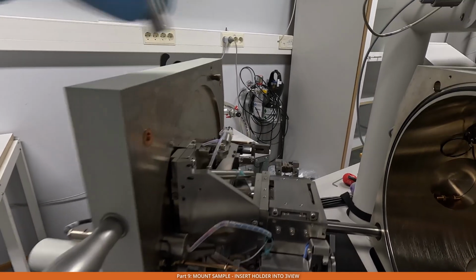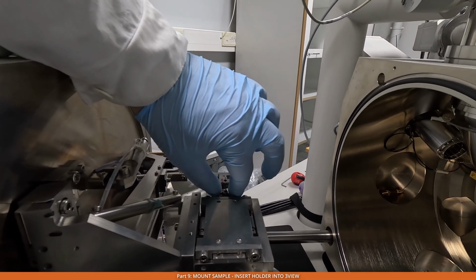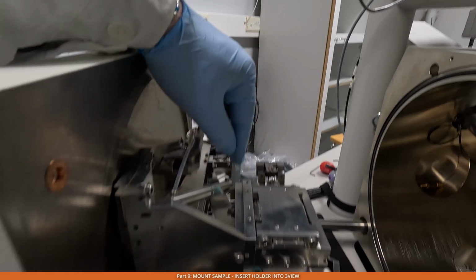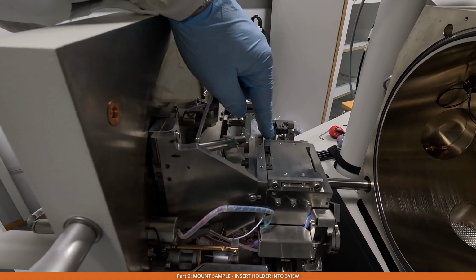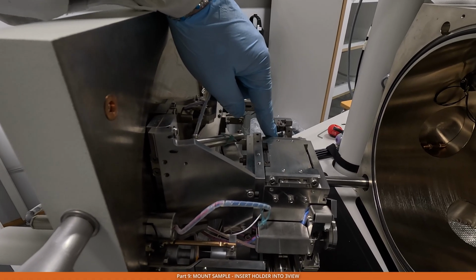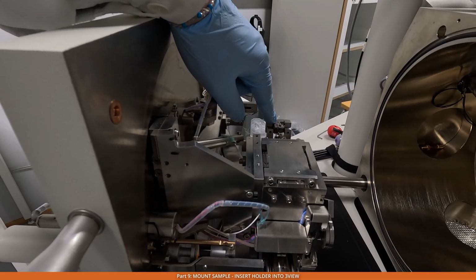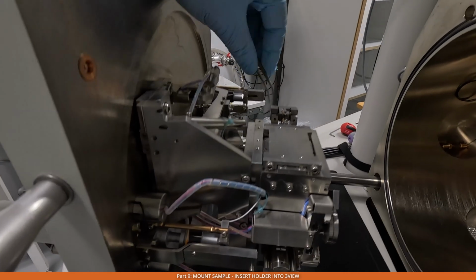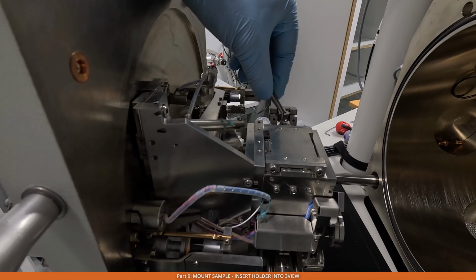Now we take the sample and put it inside this holder in the 3 view. Make sure that it goes all the way to the bottom. Typically we'd like to keep the screw from one side always, because otherwise, if it will be in a weird position, maybe like this, it can hit a little bit into the assembly of the knife. So in our case, we usually keep this screw towards the door always, like this.